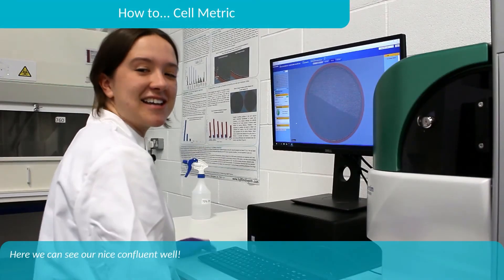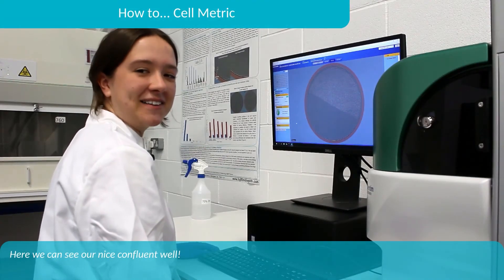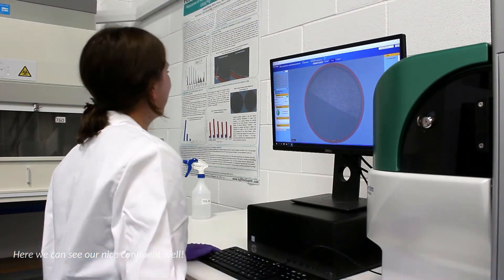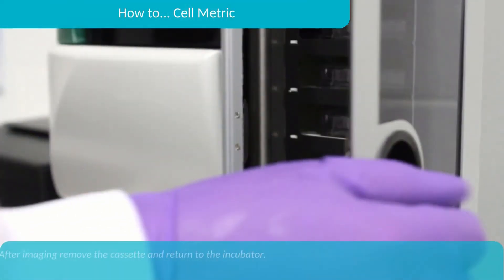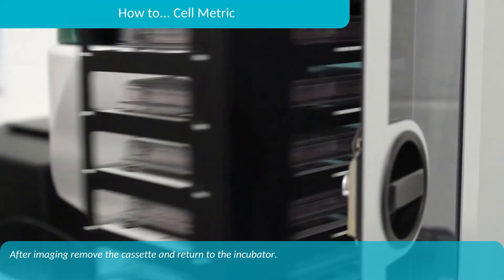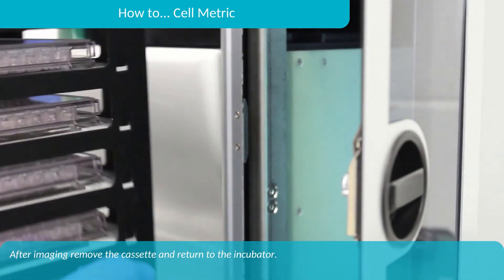Here we can see our nice confluent well. After imaging, remove the cassette and return to the incubator.